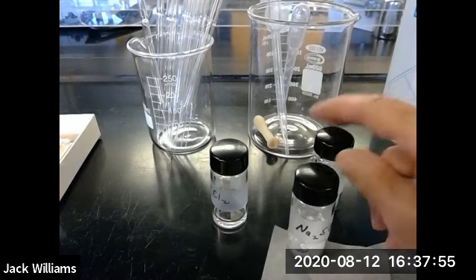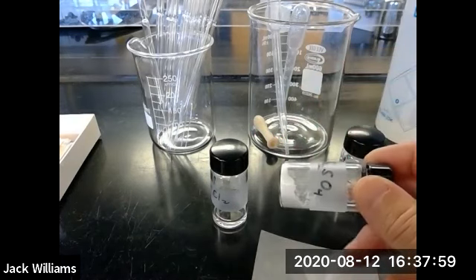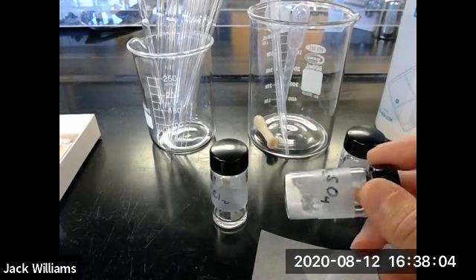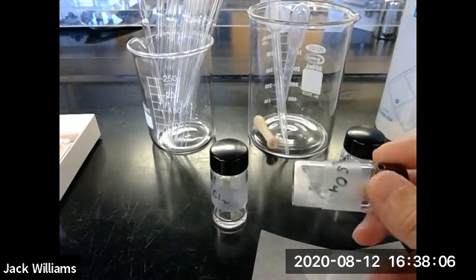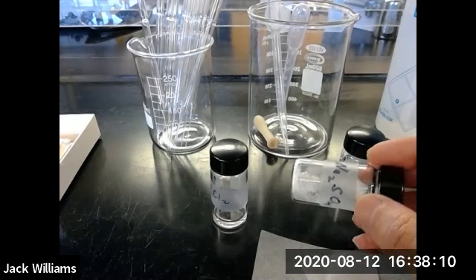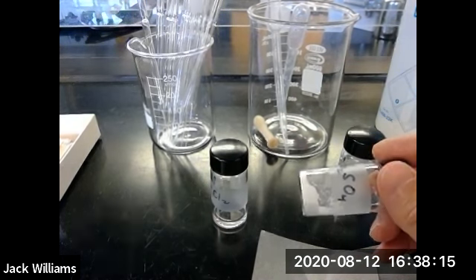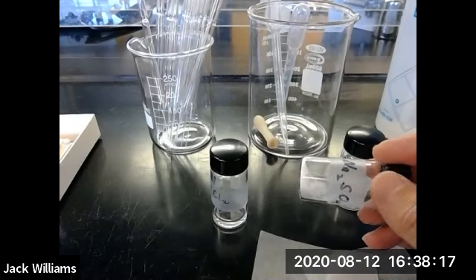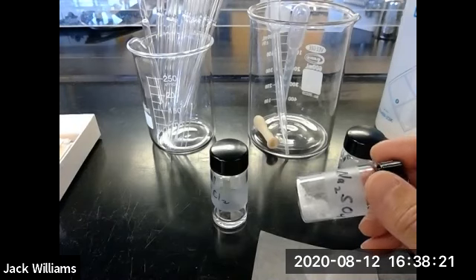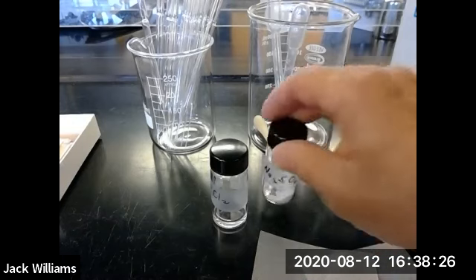So you've got benzoic acid, you have sodium sulfate, which is a drying agent, which means it removes moisture from something, in this case, organic liquids. Believe it or not, even though organic liquids are insoluble in water, there's a certain amount of water that may get taken into the organic liquid, and you want to dry it. You want to take this out. If you don't, then when you evaporate your organic liquid, you'll have droplets of water in your sample.